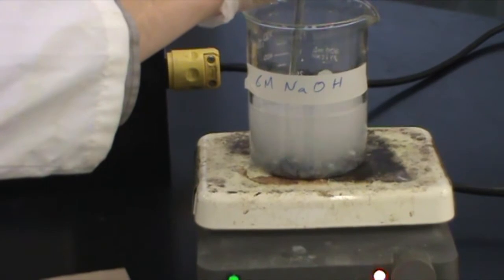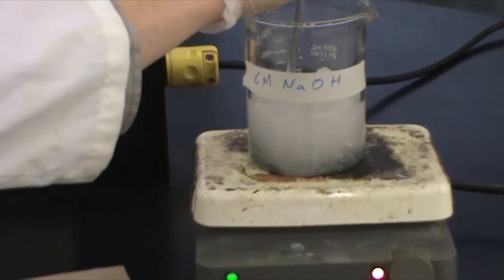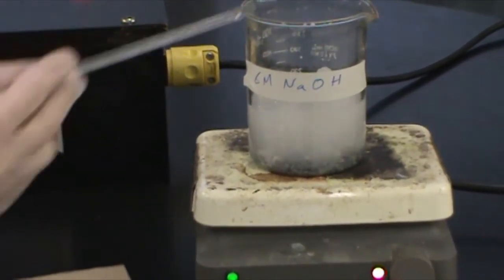It's tough to see, but the zinc is already beginning to collect on the sides of the copper pennies.